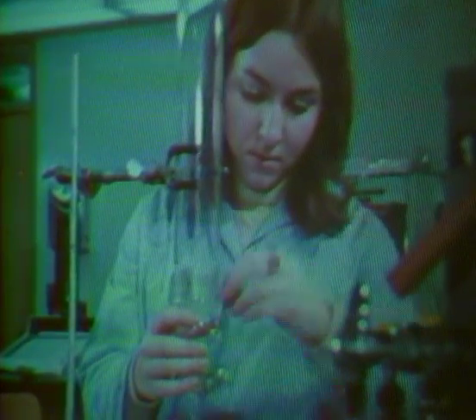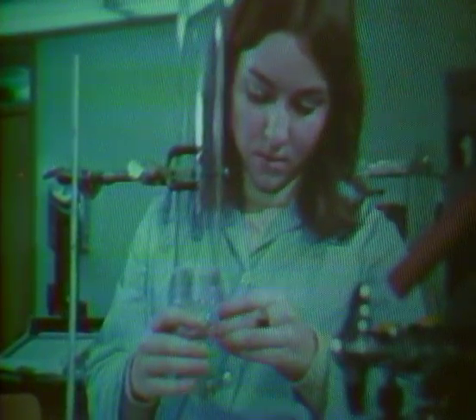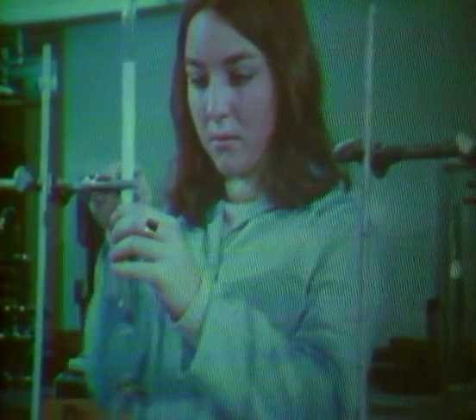Usually, straight glass tubes equipped with filter plugs are used as columns. The larger diameter columns are used commonly and routinely for preparative scale separations.